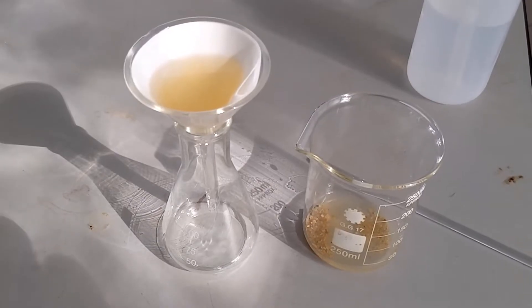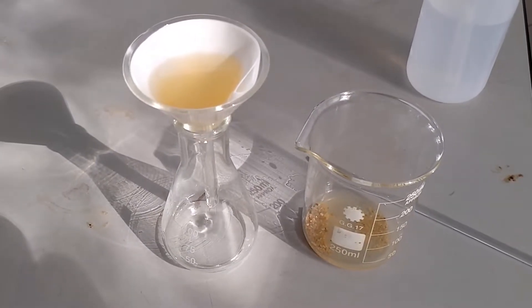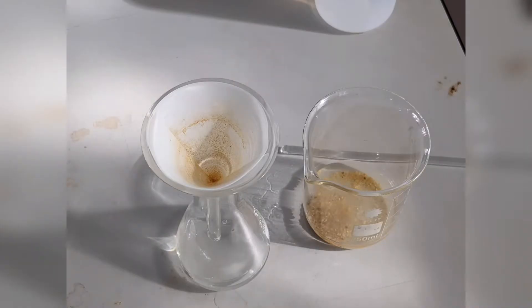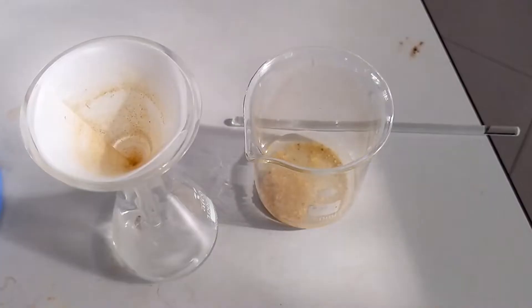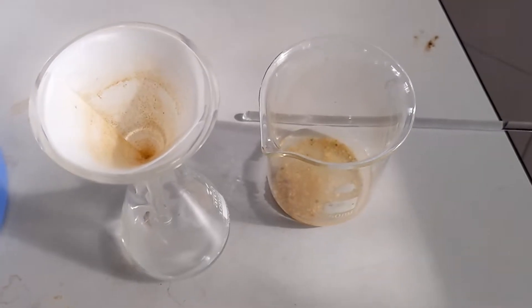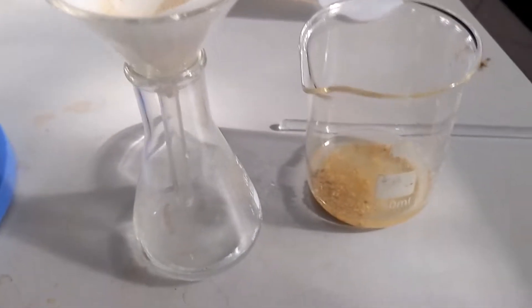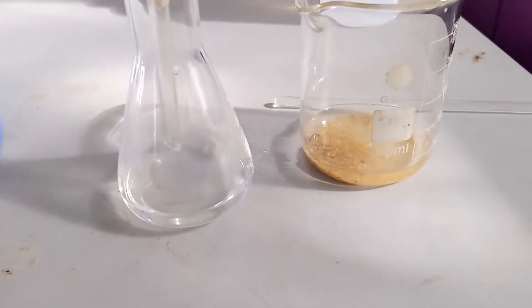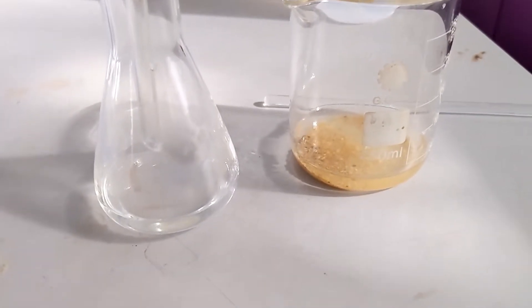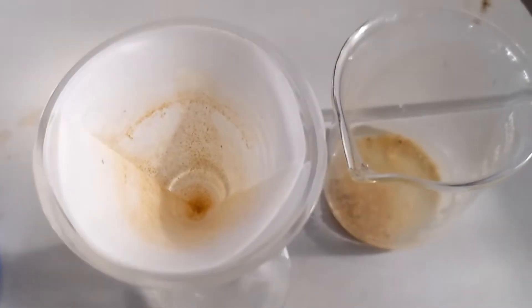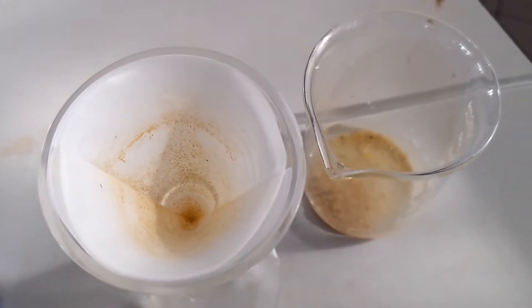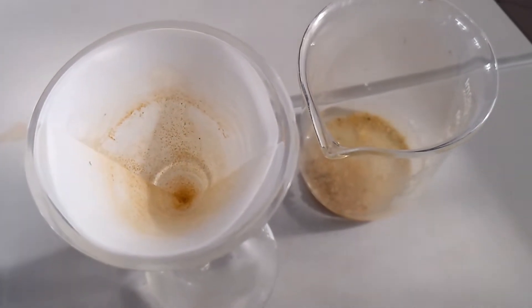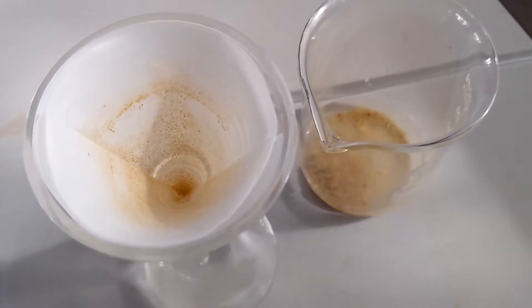It takes time. Here's our mixture after it's filtered. We've got the filtrate at the bottom and in the filter paper we've got the insoluble residue. Which is which?